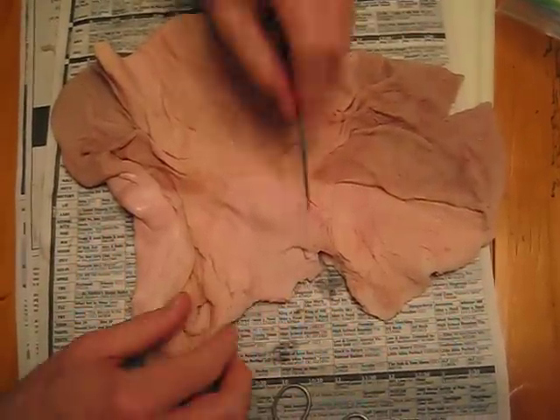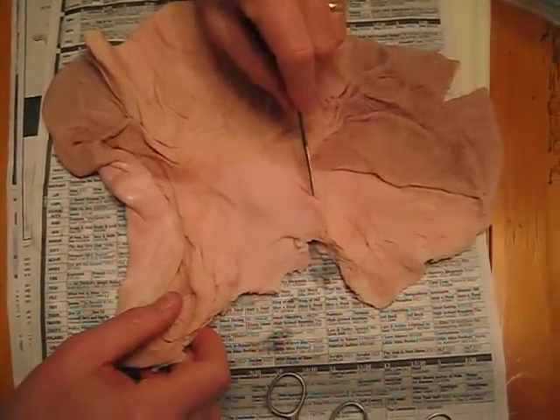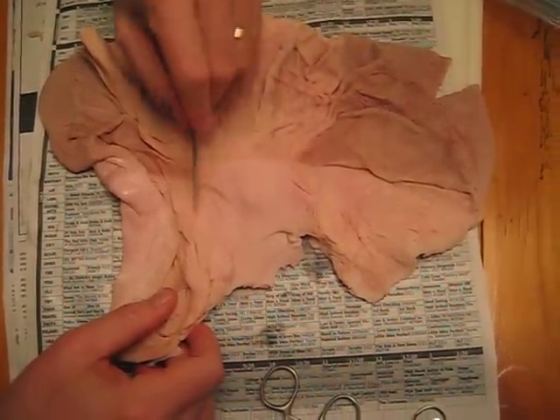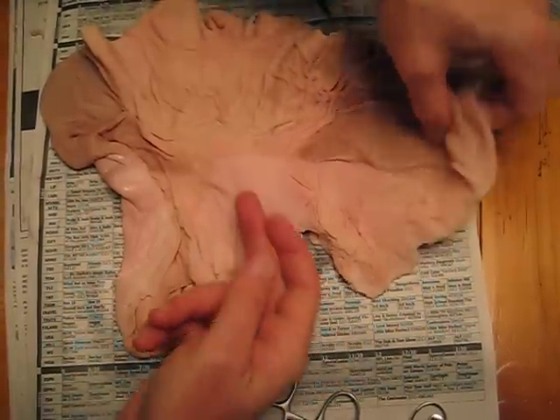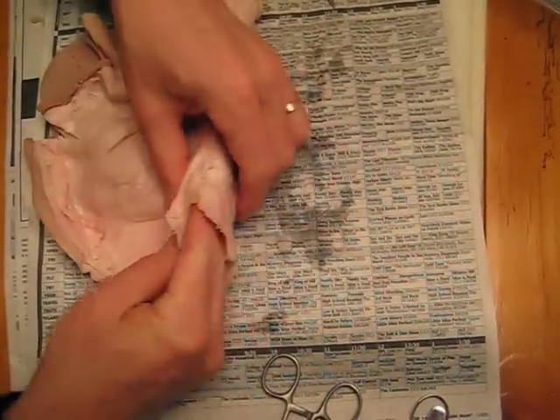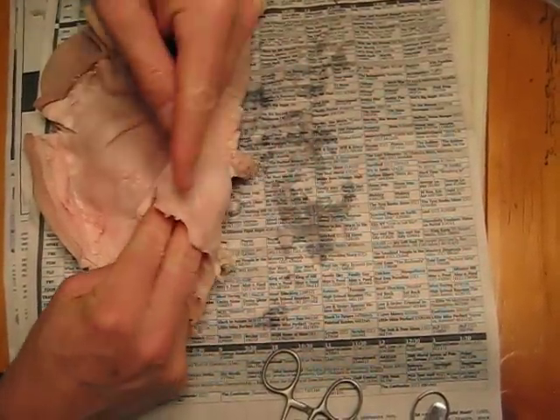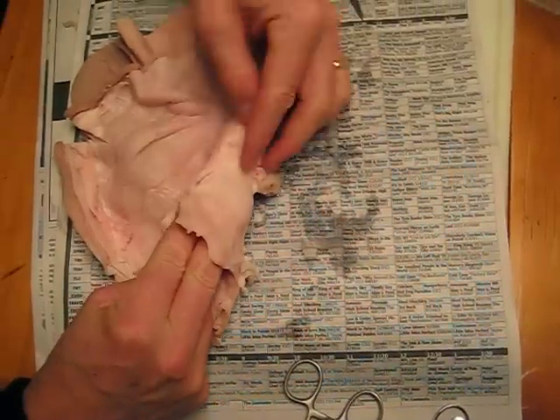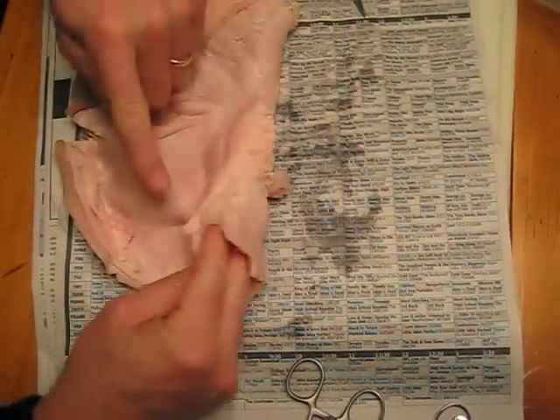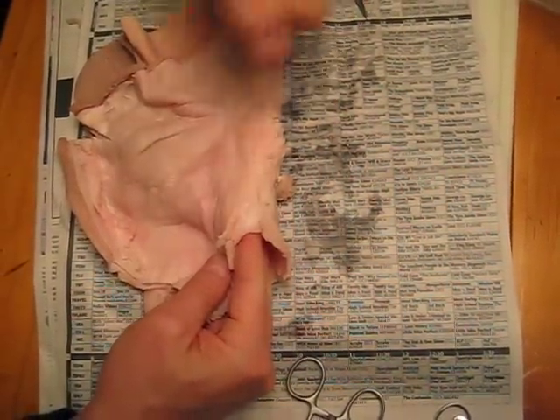This area is the inside of the lowest part of the esophagus, and you can see it when I fold the stomach over this way. That's the esophagus. This is longitudinal muscle on the esophagus entering the stomach. That's circular muscle that allows it to constrict.